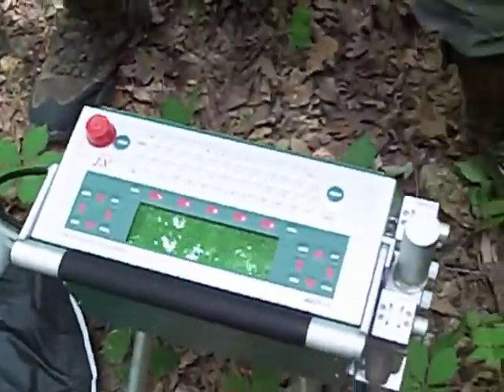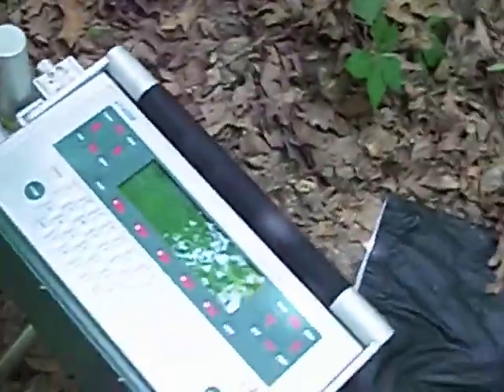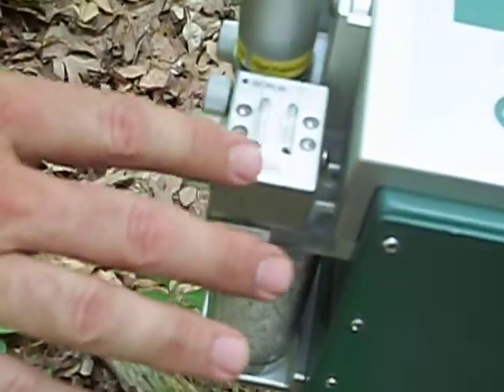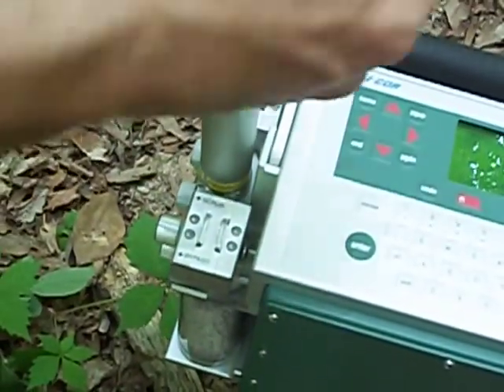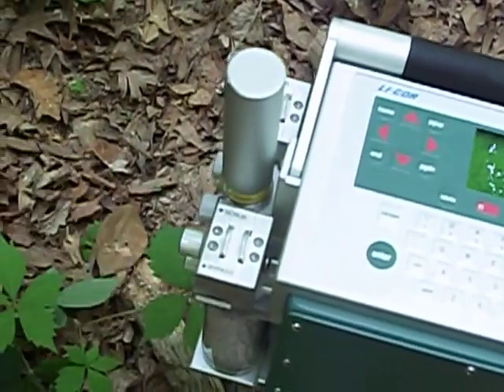And what does all of this do? I don't know if I can get a shot of this. Here is the unit itself, and we have scrubbers over here. This scrubber pulls carbon dioxide out of the atmosphere. This is a tube of CO2, so that I can control the exact amount of carbon dioxide that goes into the leaf while we're taking measurements, instead of just using what's in the atmosphere.